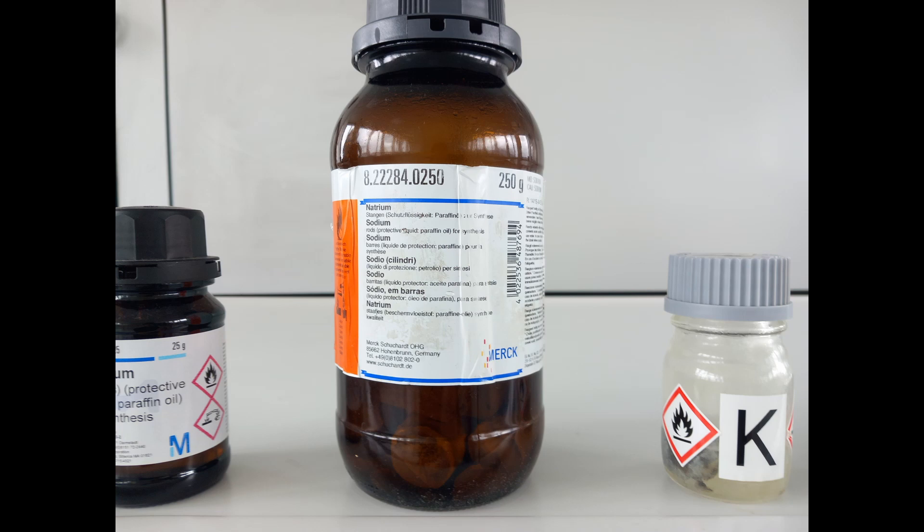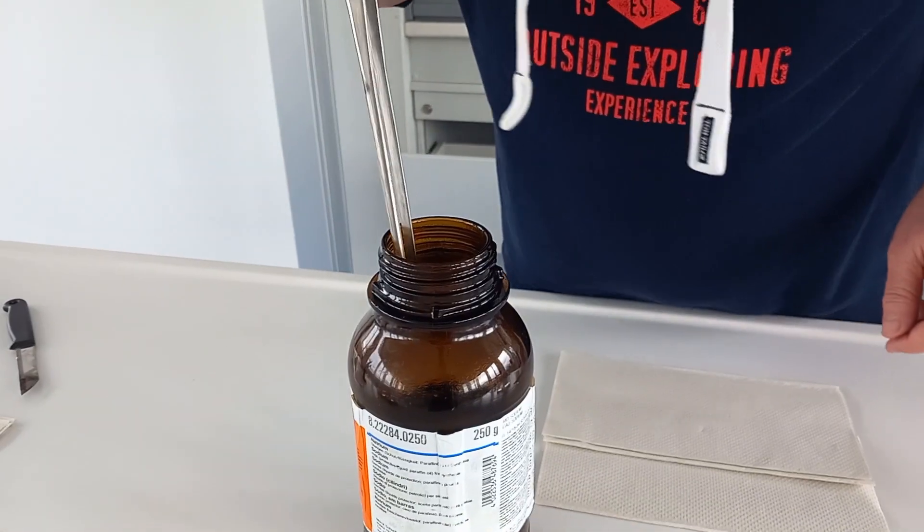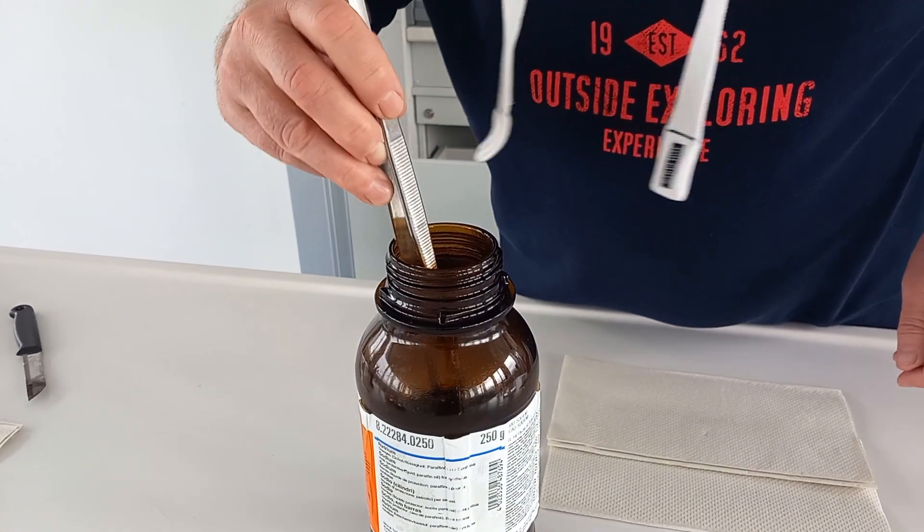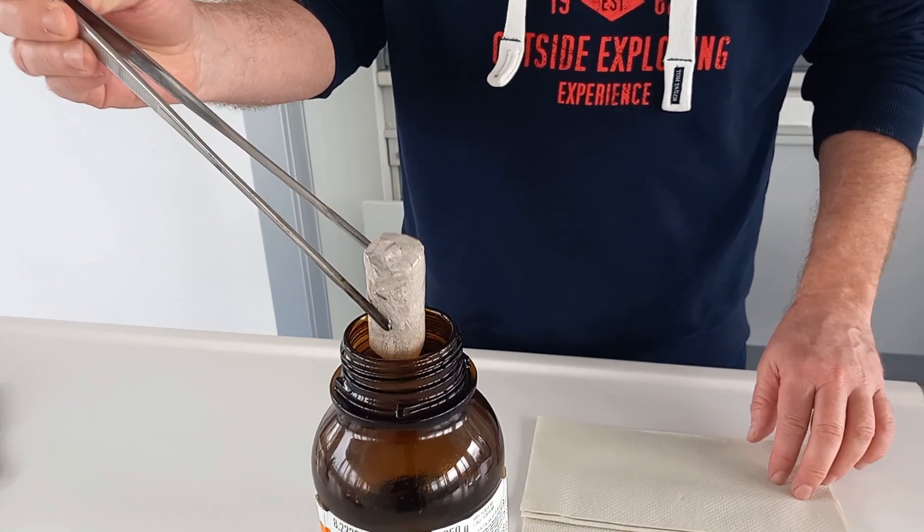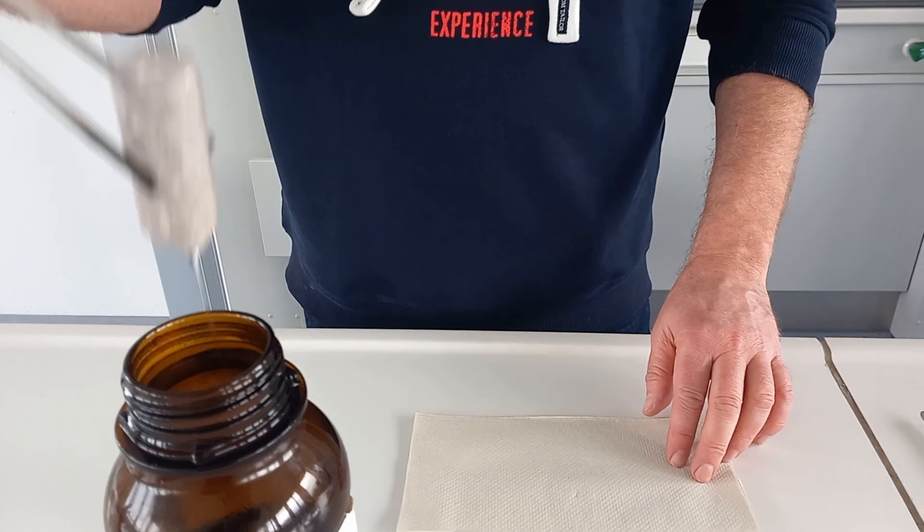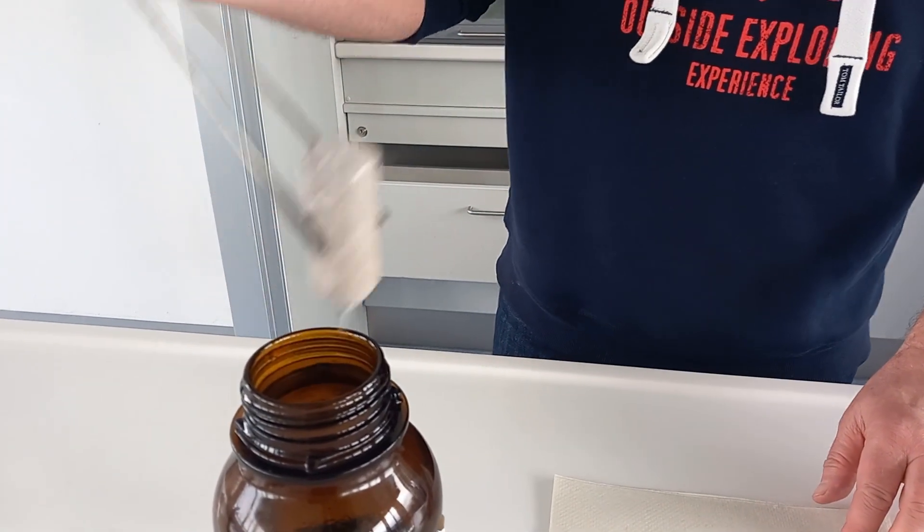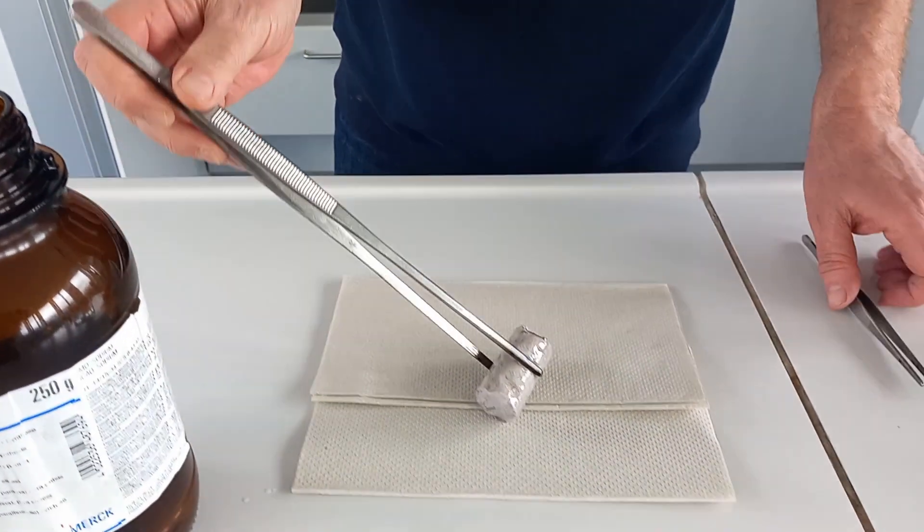The next alkali metal is sodium. The sodium has to be stored in mineral oil because otherwise it starts to react with the air.